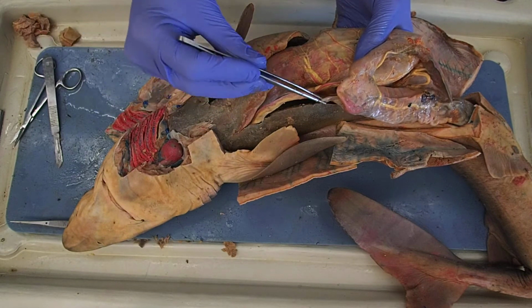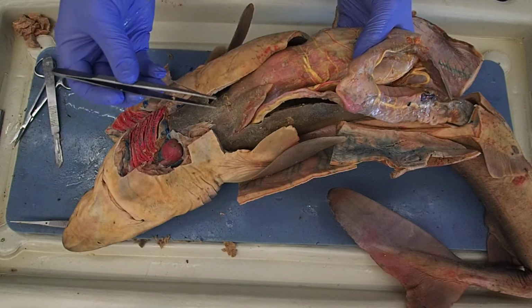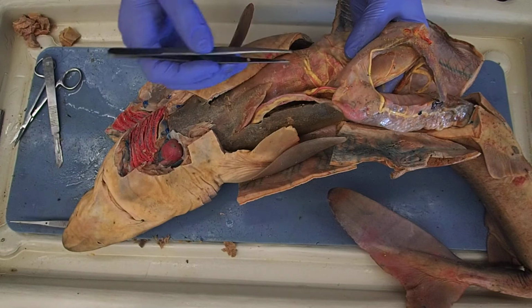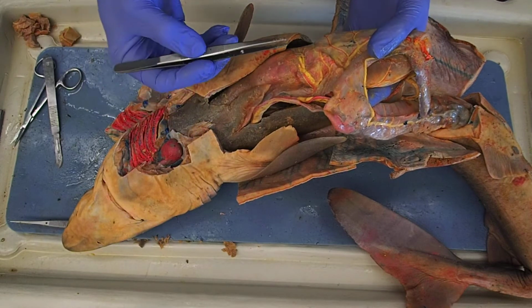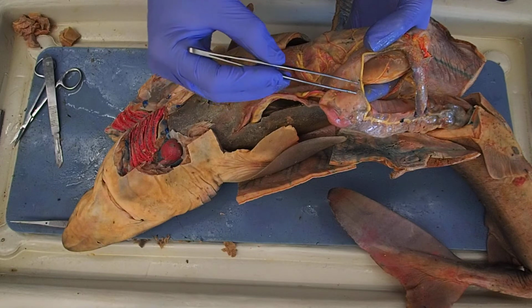The gallbladder and liver are draining bile into the duodenum via the hepatic ducts. We've talked about those. And we'll also see this glandular-like material here. I apologize that you can't see. There's not great light in here right now. My light actually just broke that I've been using. But this would be the pancreas.